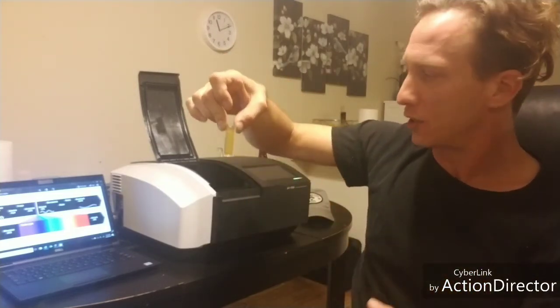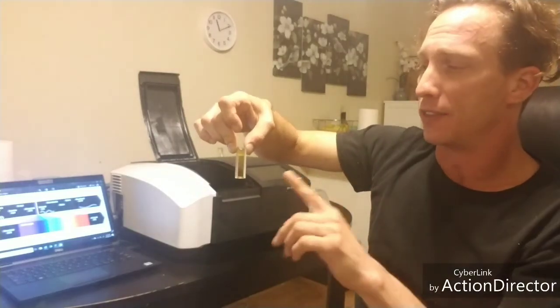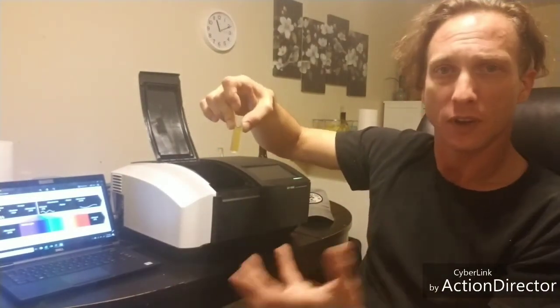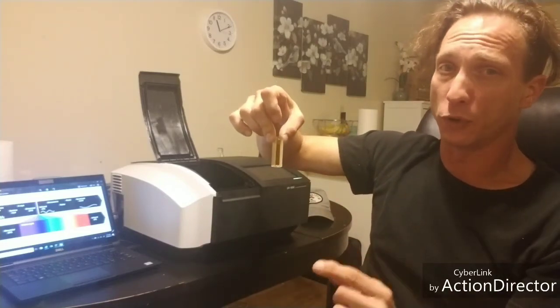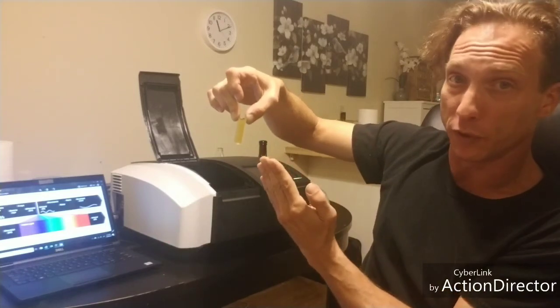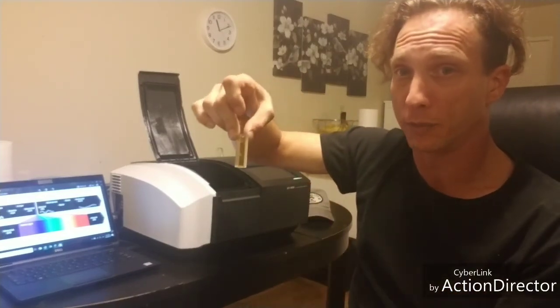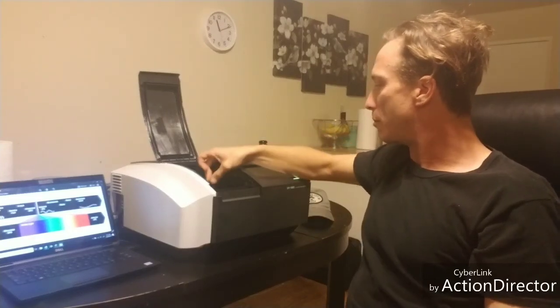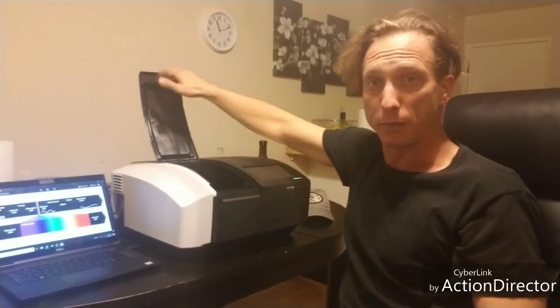And another strange fact is that yellow is the most common color for a chemical for this reason, because most chemicals are going to absorb in the UV range, but some of that spills over into the visible spectrum, and that's where we get these colors from. So what I'm going to do is I'm going to take this thing, put this into the instrument, and try and measure a spectrum, and then I'm going to show you guys what the spectrum looks like, and then explain Beer's Law and how we do analytical chemistry.